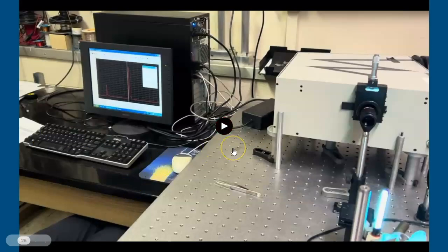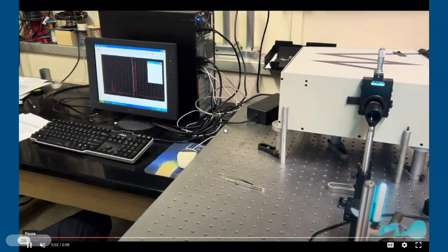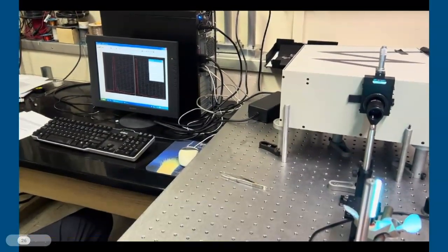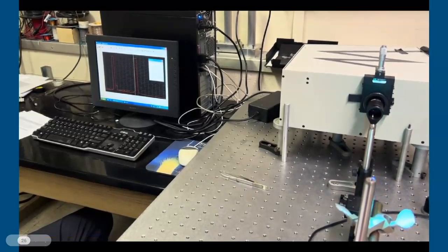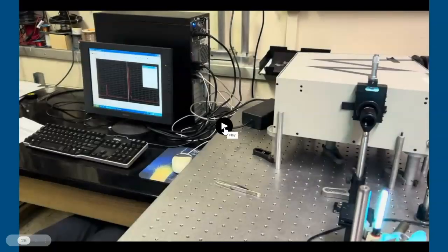So here is an example of the location of the light changing what the perceived wavelength is. You can see our calibration lamp, we're moving it in a circle from one side to the next, and as it's moving, it's changing what reading of the wavelength is given on the screen.